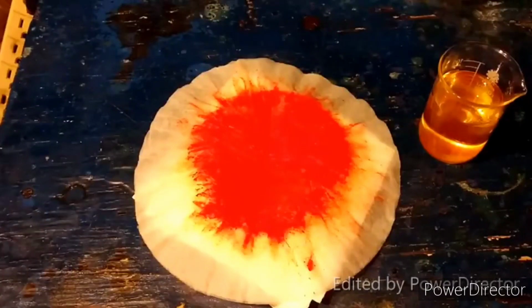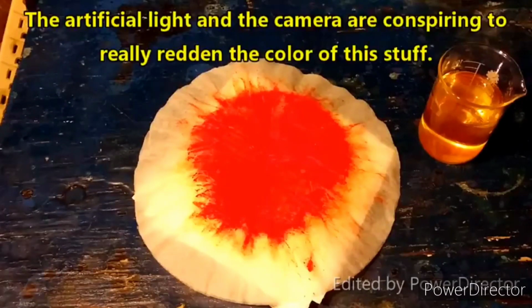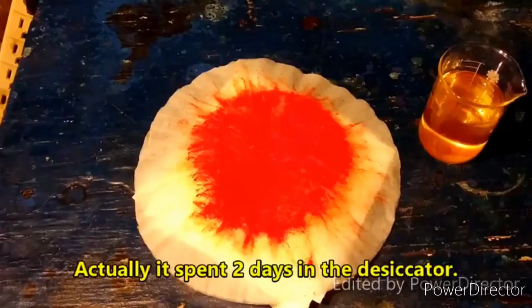Okay, everybody, here is the final product. The camera is making it look far more red than it actually is. In real life, this is clearly slightly reddish orange. I would absolutely say it was more orange than red. But anyway, what I am going to do now is allow this to dry out overnight in the desiccator, and we will take a look at this in the morning.